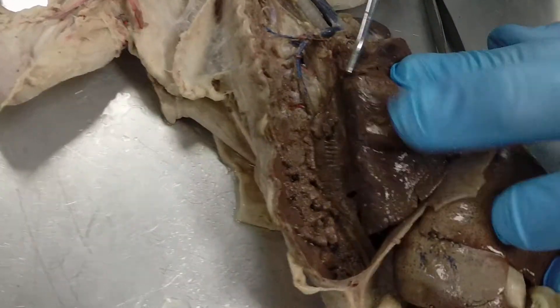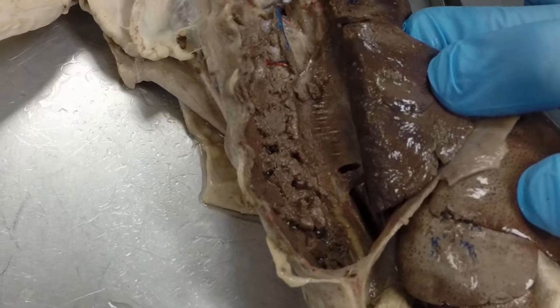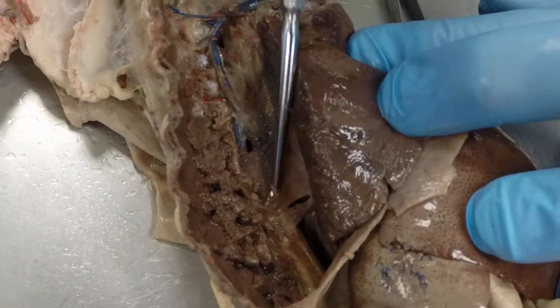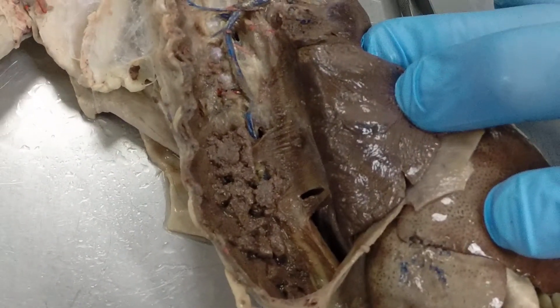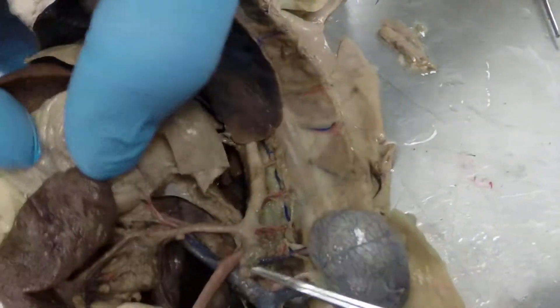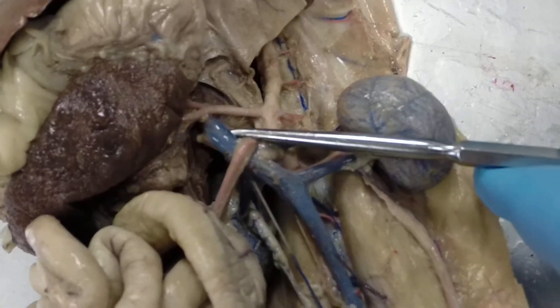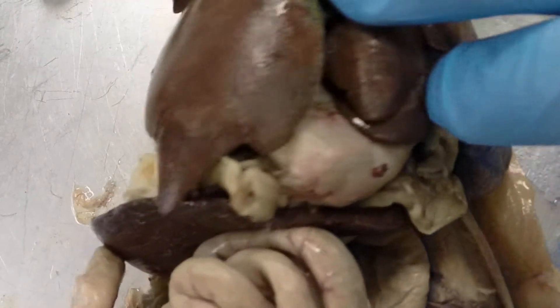Going over on the right side near the ribs, we have the azygous vein right there — it's not really dissected out, but you can see it clearly enough. Next, moving into the abdominal cavity, we have what we call the postcava — this is called the postcava anywhere posterior to the heart.